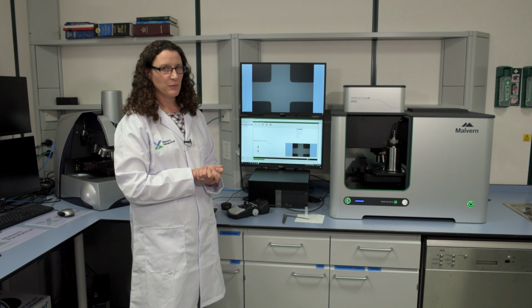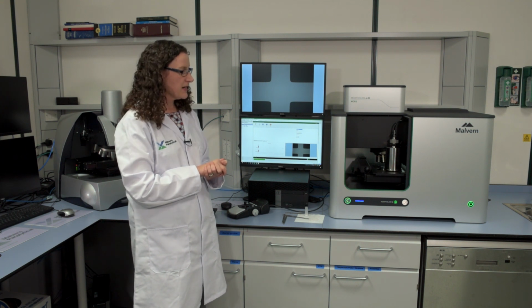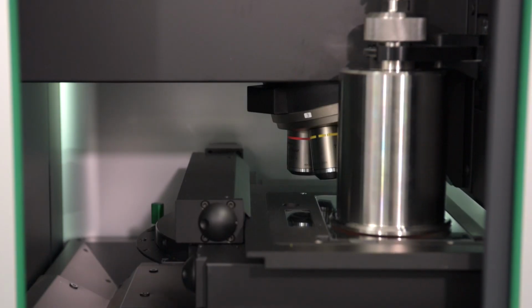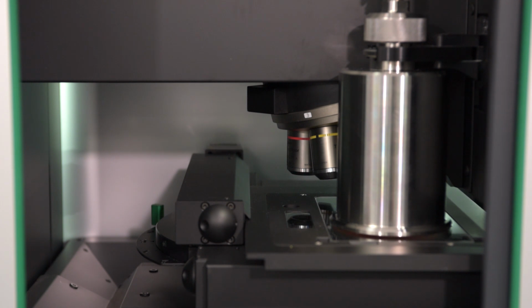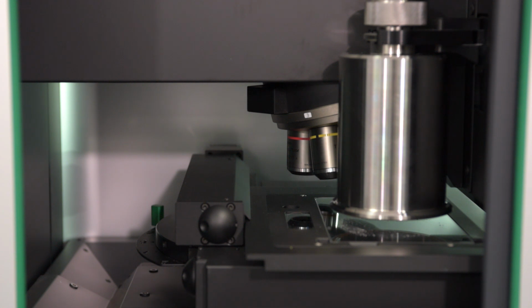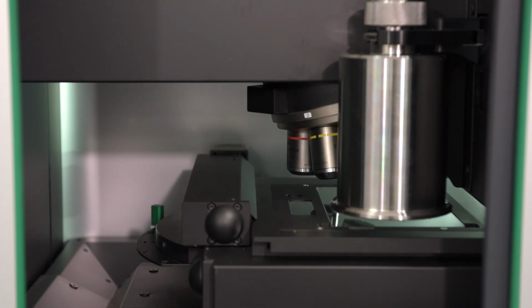It's now dispersing the sample. So you can see a seal is made between the sample dispersion unit and the stage. They come together and close. And you may have just heard that little puff of air, and that was the sample being dispersed. We control the pressure that we disperse it at, the injection time, and how long we allow the sample to settle. I've just done a few seconds today. The clicking that you can hear is the removal of excess pressure, so we don't end up dispersing the sample all around the lab. The sample dispersion unit is lifted, and we can see that our sample is dispersed nicely onto the plate.